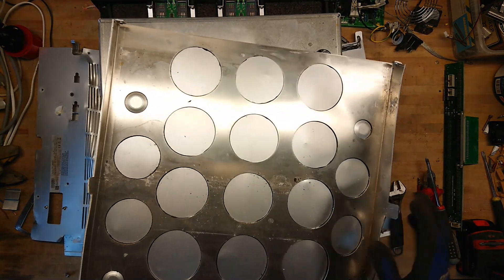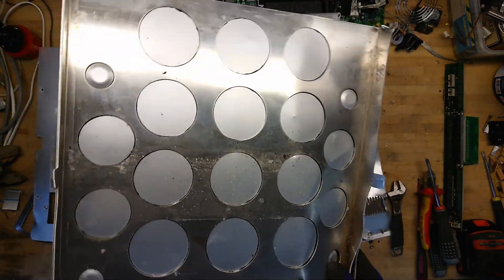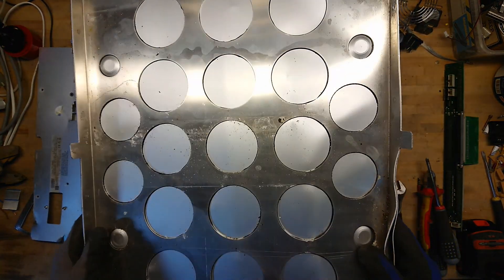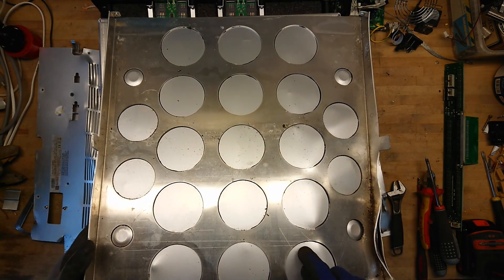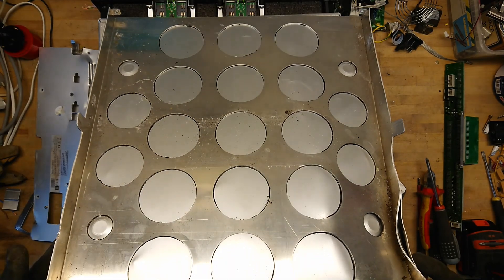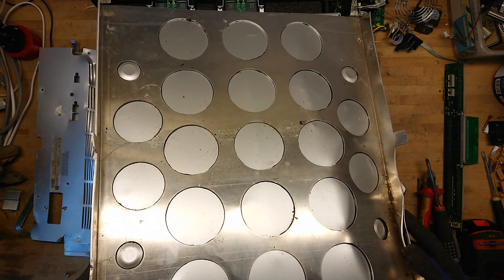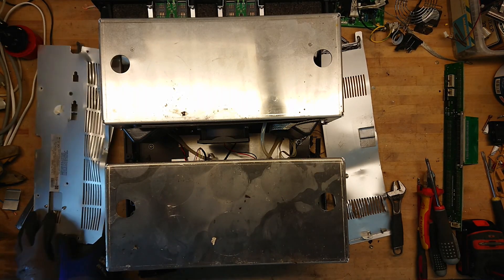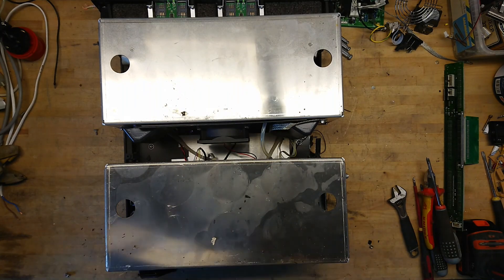So let's get all that shielding off and see what's inside. It actually has cutouts in the whole shielding here. I'm not quite sure what that is for, because it has another plate on the outside. Maybe this is just some kind of rigidity reinforcement, or maybe some kind of noise reduction, temperature, or insulation. But it just seems to be a lot of aluminum shielding.